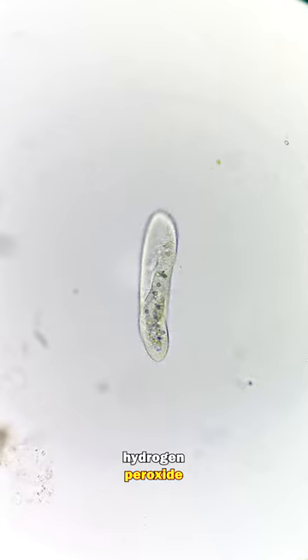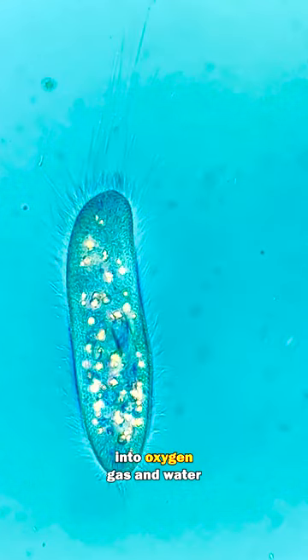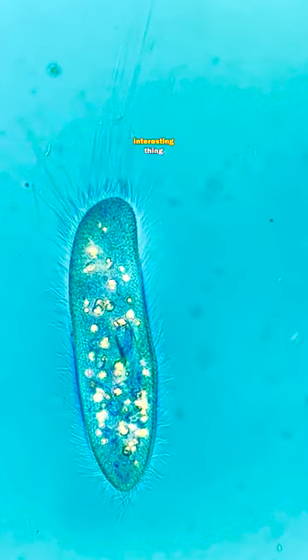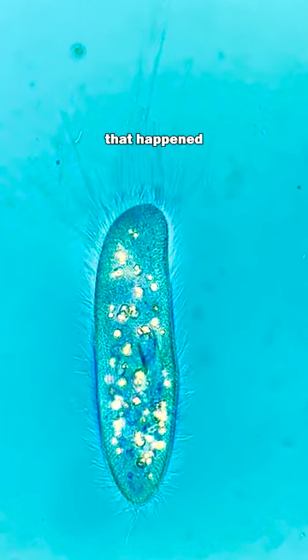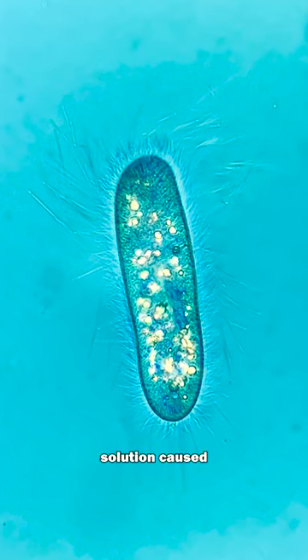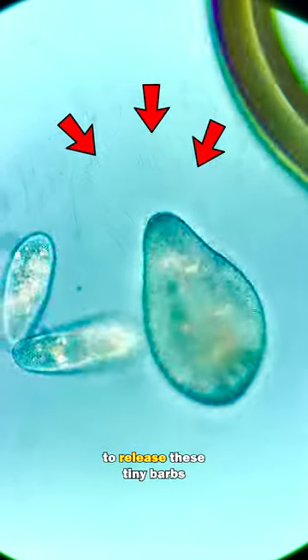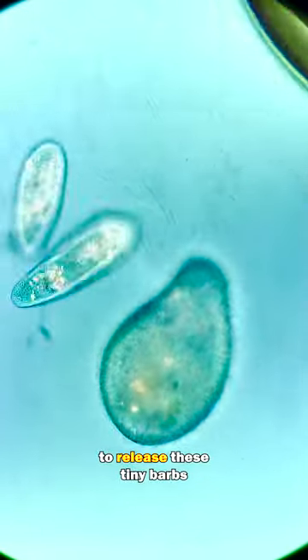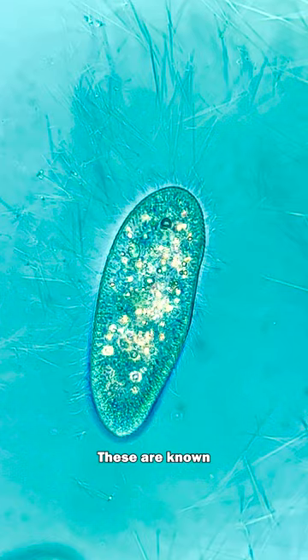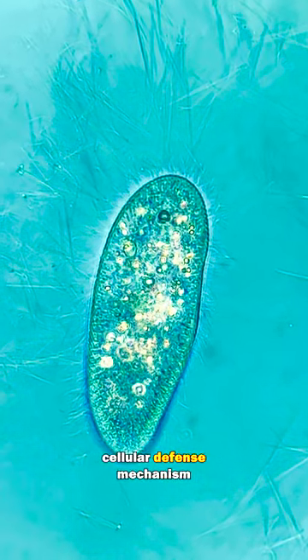This breaks down hydrogen peroxide into oxygen gas and water. But here's another interesting thing that happened: the hydrogen peroxide solution caused many of the cells to release these tiny barbs. These are known as trichocysts, and it's a cellular defense mechanism.